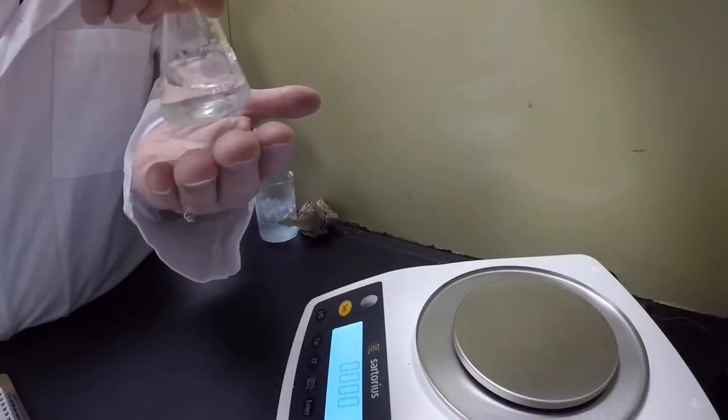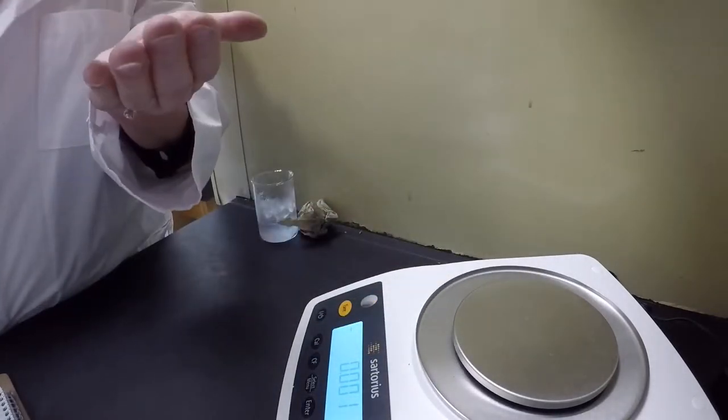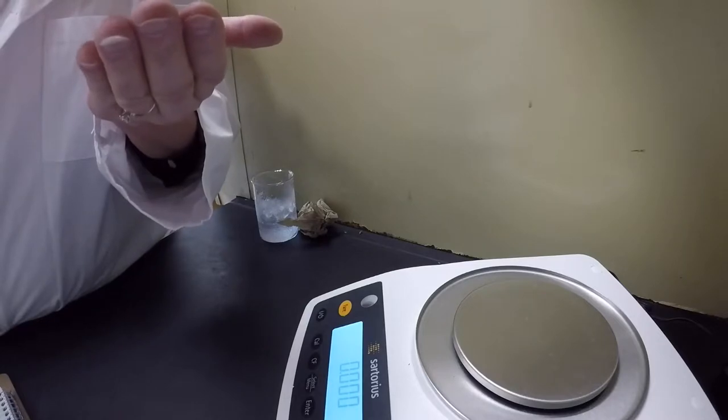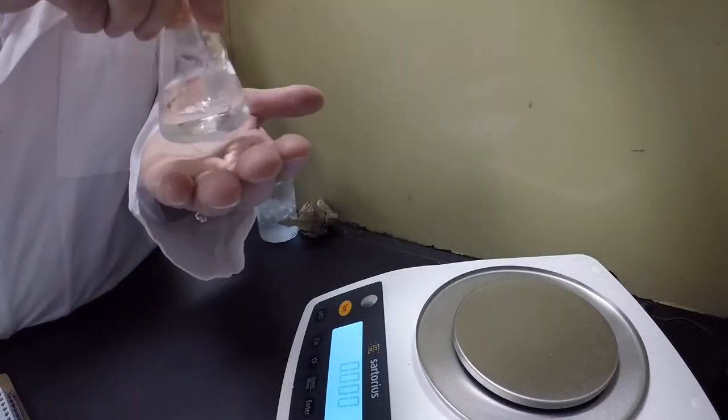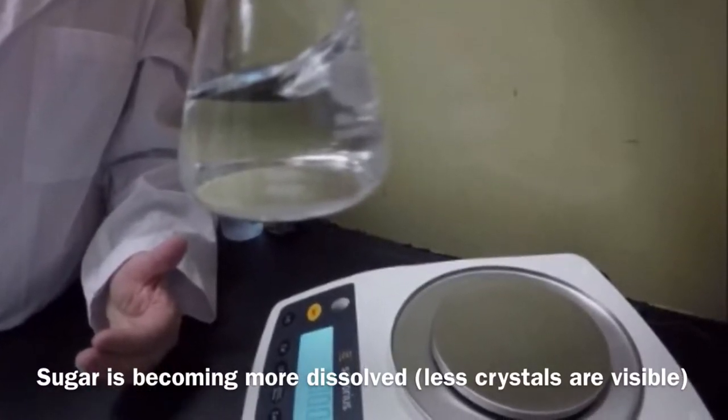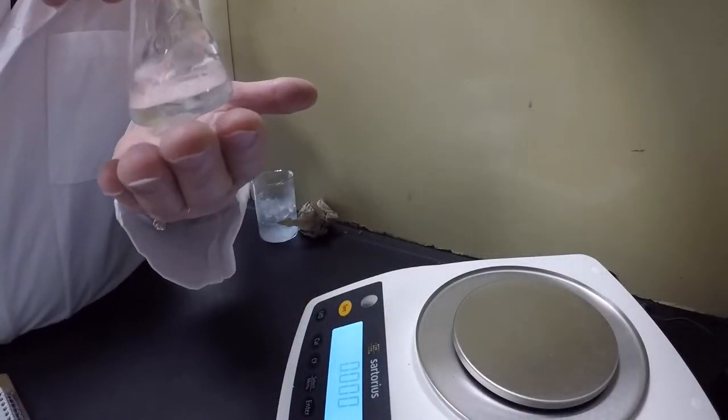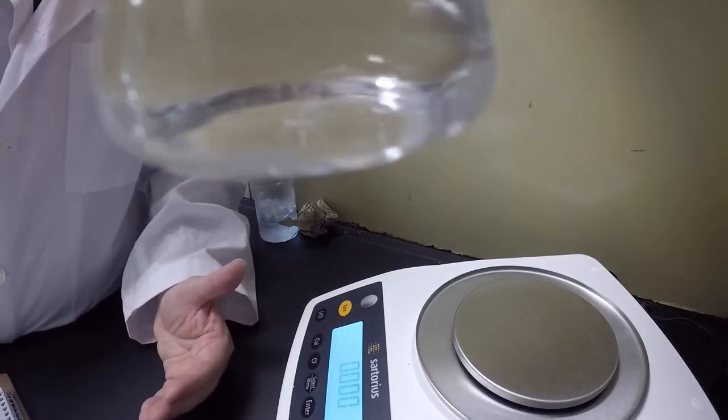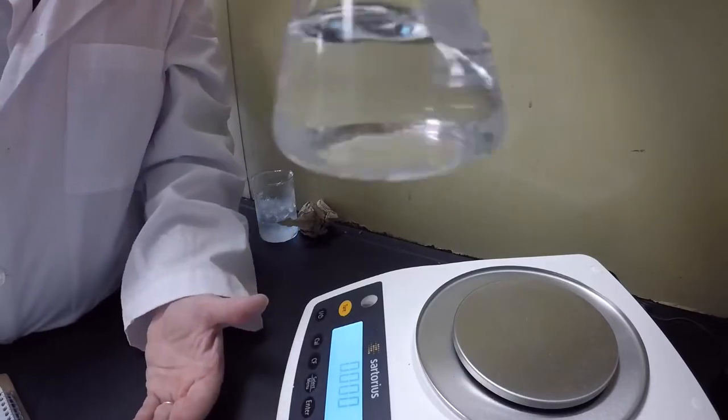It's dissolving in the water. Slowly, slowly it will change. You can see now there's less of it. There's even less of it. And the sugar is almost gone.